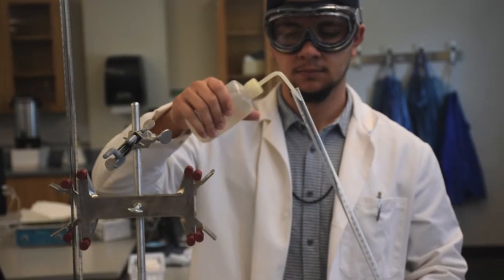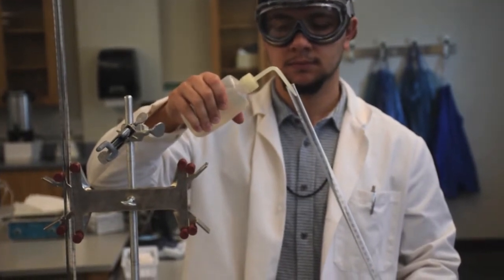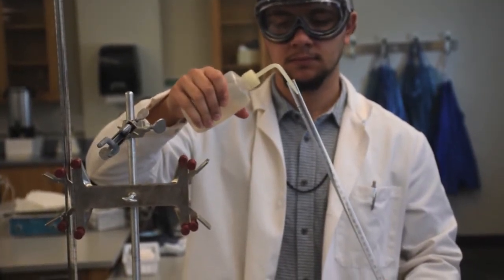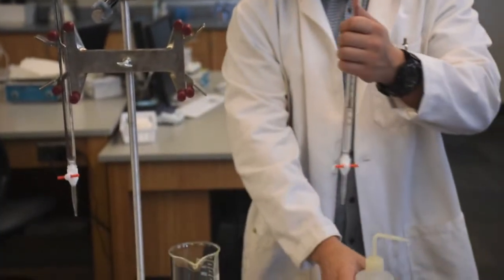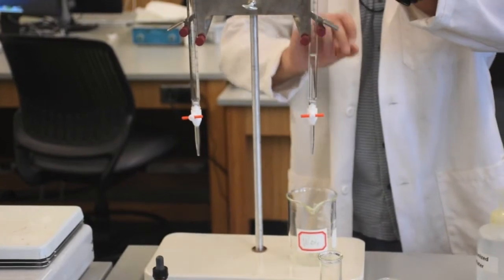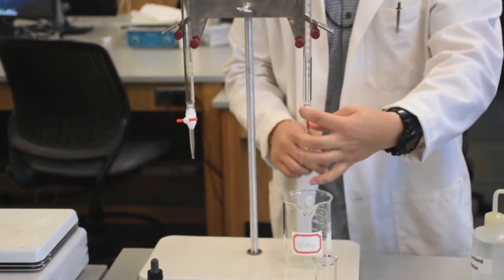To do so, rinse your burette out one to two times with distilled water. This will cause any particles on the burette to go into solution and will be washed away. Once you have filled the burette, turn the stopcock once and allow some of the water to run through the dispensing tip.